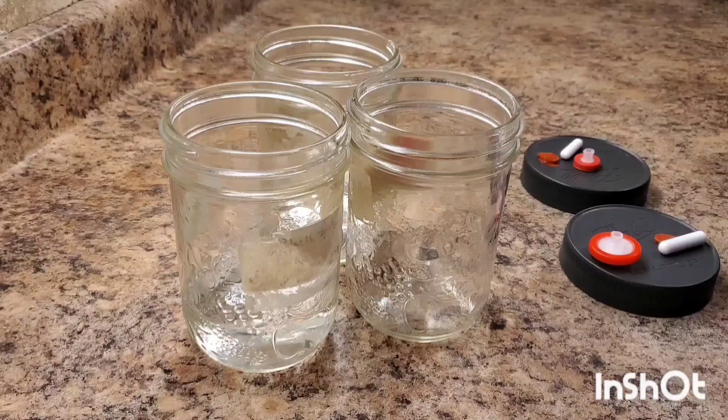You can use all different kinds of sugars for this process. It ranges from honey, dextrose, malt, and you can also add other nutritional sources for the mycelium to get familiar with as well. But we're going to keep it really simple today and we're doing a malt extract and dextrose liquid culture.